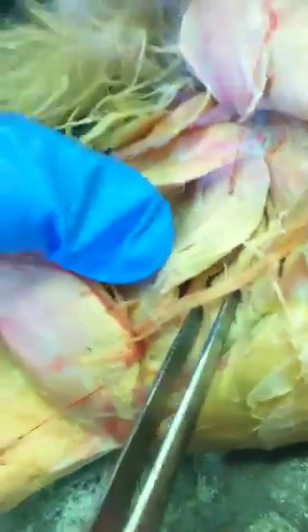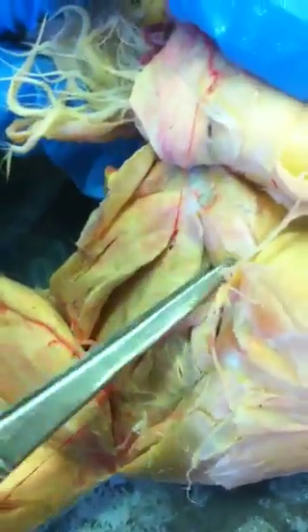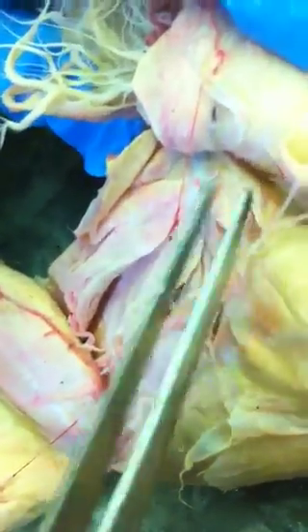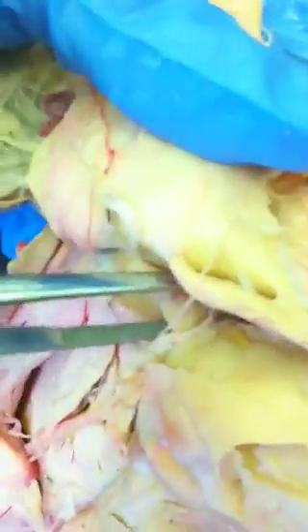Adductor longus. This is the obturator externus. And then over here we see three separations coming from the same origin. This is the quadratus femoris. This one is the obturator internus. And then the more cranial one is the gemellus cranialis.